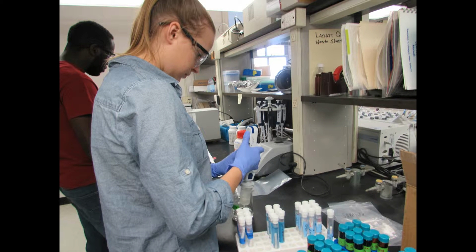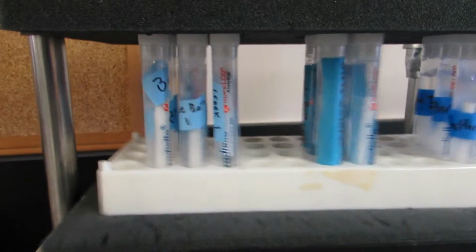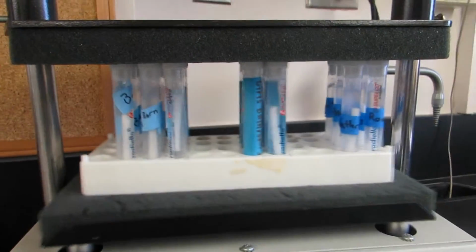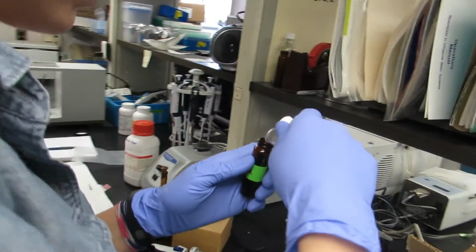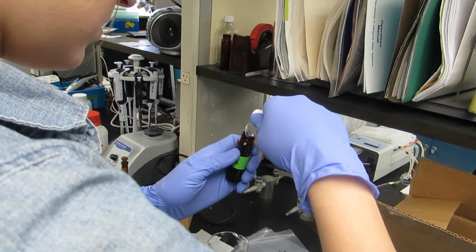To get the ammonium collected into water, we opened the radiello tube and added 10 milliliters of deionized water to the cartridge in the tube. We recapped the tube and stirred vigorously in a vortex stirrer for a minute. Then we transferred 1 milliliter of the solution into a glass vial and repeated this for each sample using a different pipette tip for each.